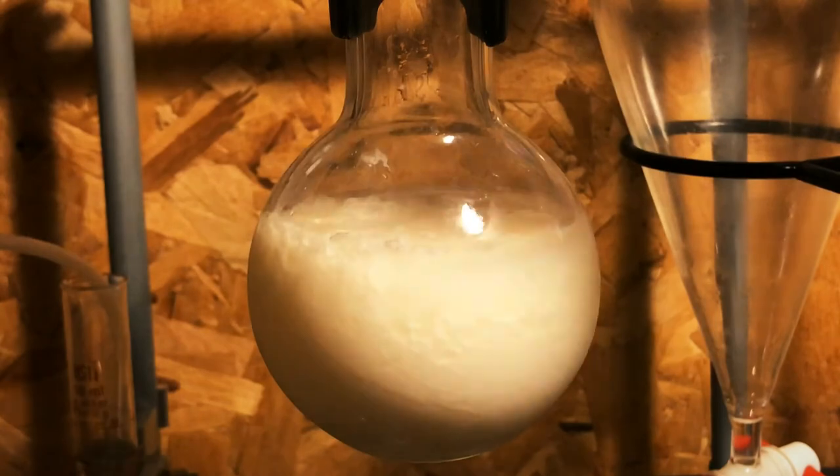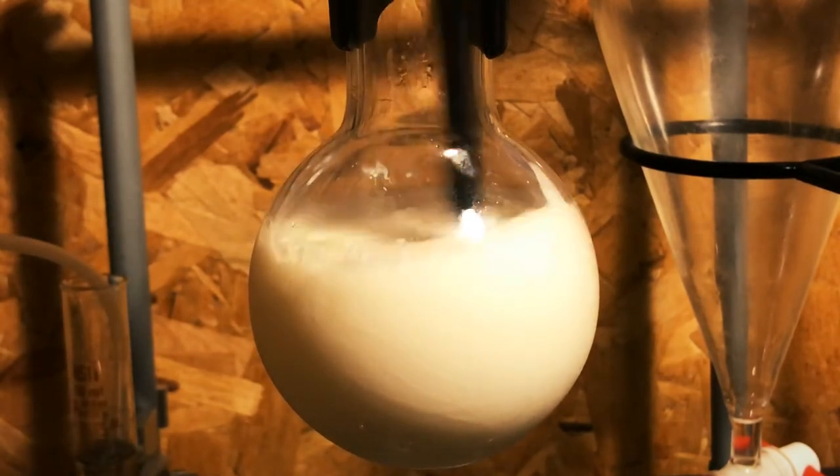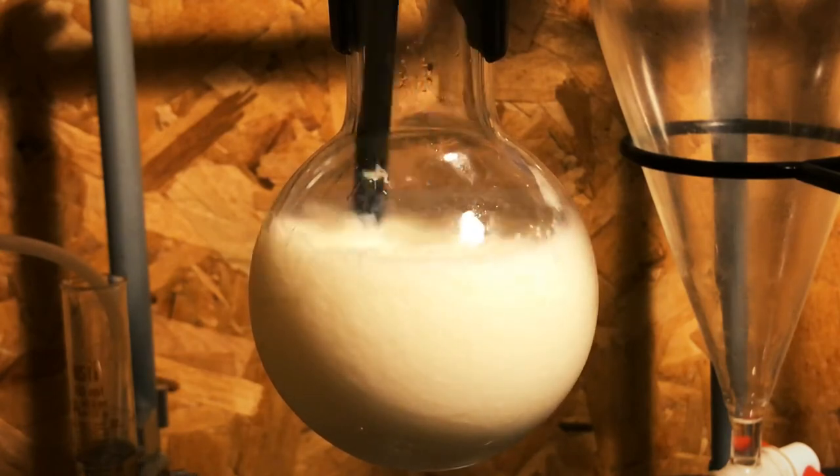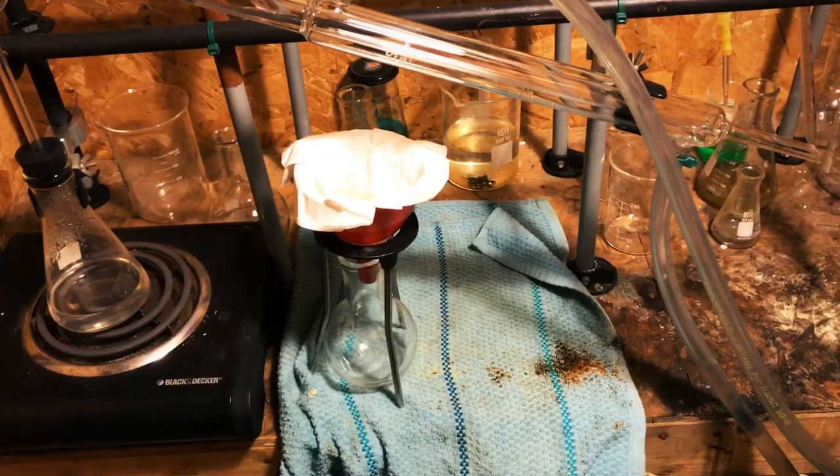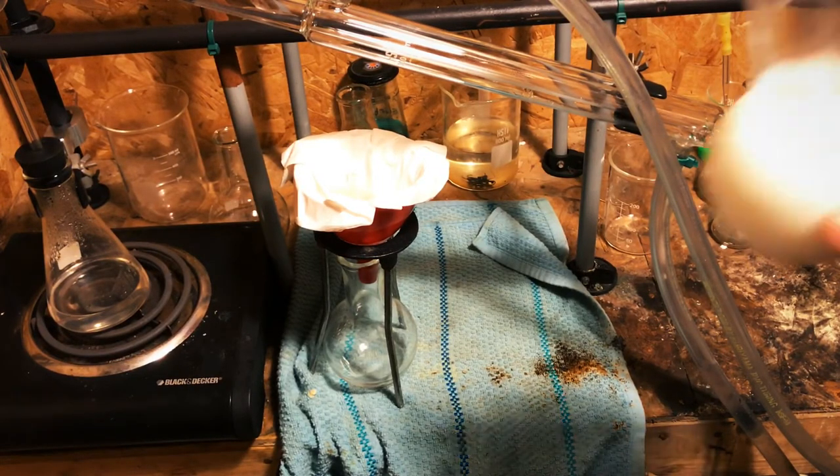I'm going to mix the solution around. I am now going to filter the solution and extract the casein.